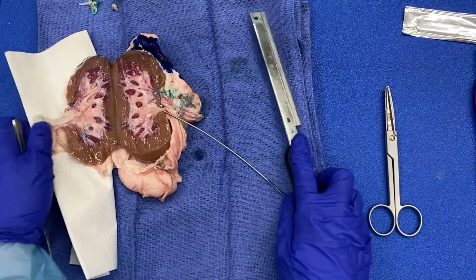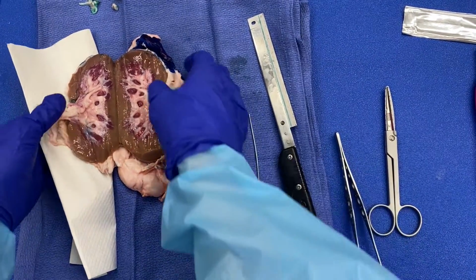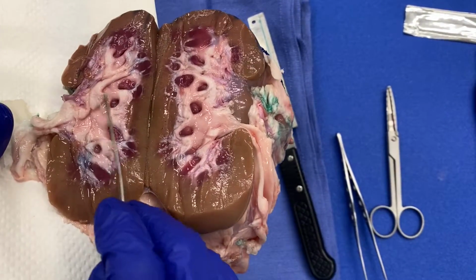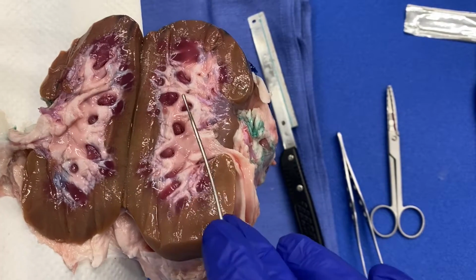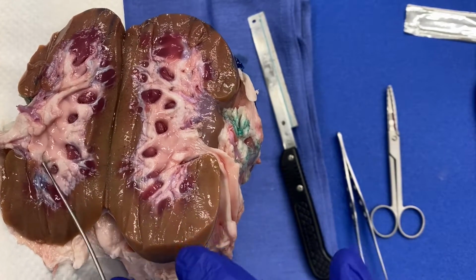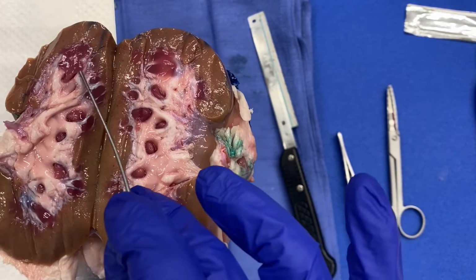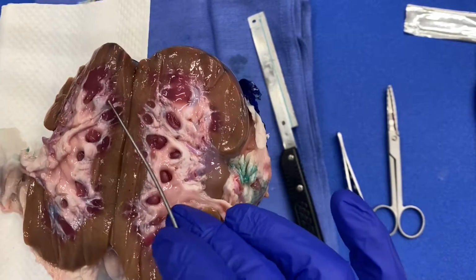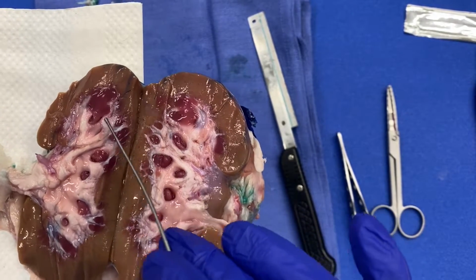All right. So what you can see here, and I'll just lift it up so you can see it a little better, is that you have urothelium on both sides, so that nice pink tan, glistening mucosa. Okay, this is your renal pelvis. You have your major calyces and your minor. Okay, this is your cortex, the medulla, and obviously these look a little different than the human specimen, but remember the medulla is pyramidal in shape.